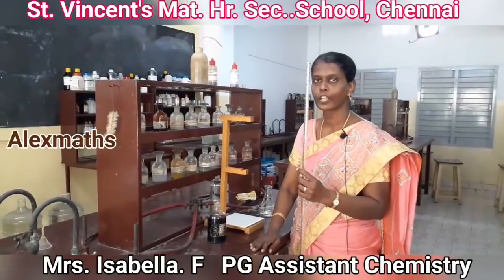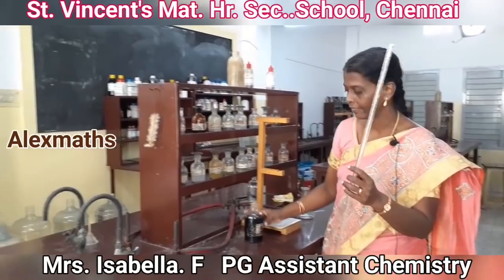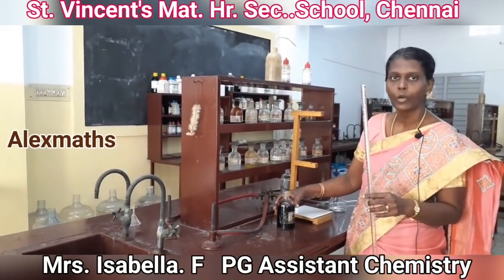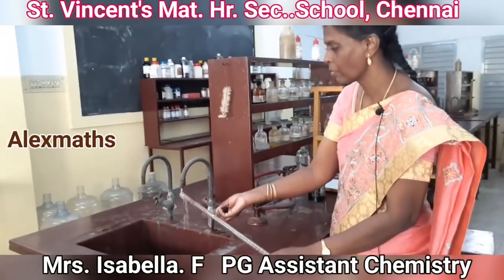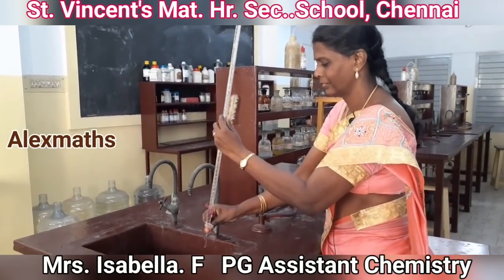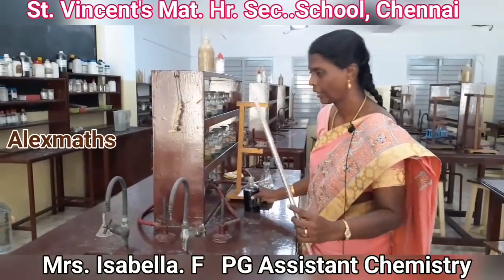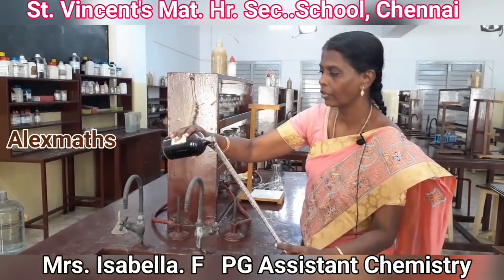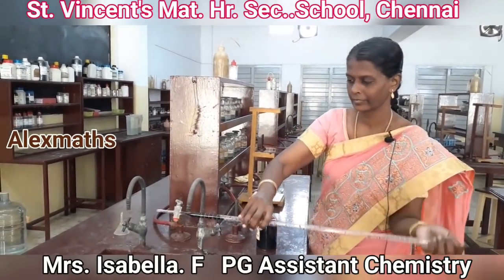First step in the titration procedure, you rinse the burette with water, and then the burette is rinsed with potassium permanganate solution, which is the burette solution. So we rinse the burette with a small amount of water. And then it is rinsed with a small amount of the burette solution, which is your potassium permanganate.